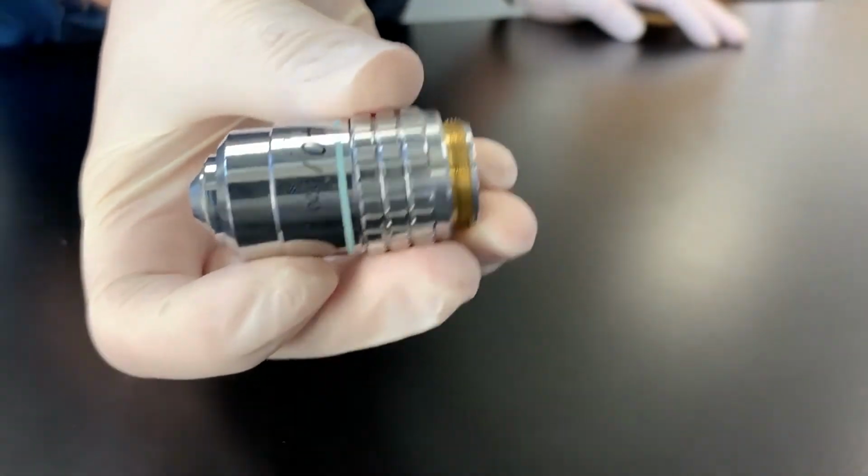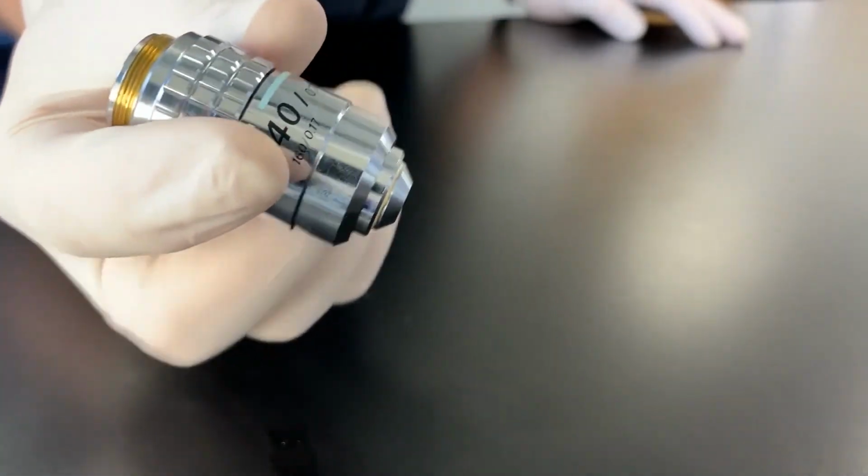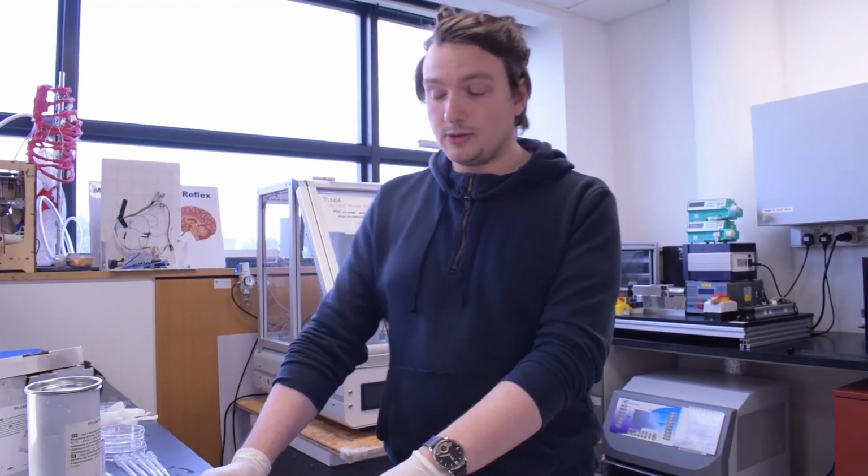You can buy really fancy, expensive looking microscope lenses with lots of mini lenses in the middle of them. We don't actually need that just to be able to see things close up. We can actually just use any old camera, and every single phone nowadays has a camera attached. So now we're going to go through how to turn your phone into a microscope.